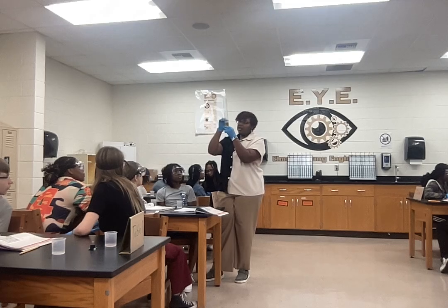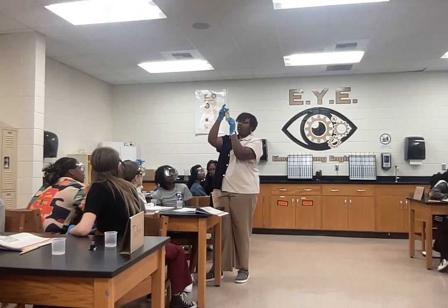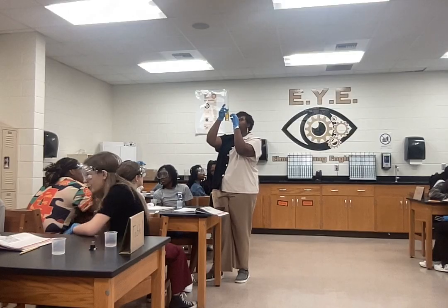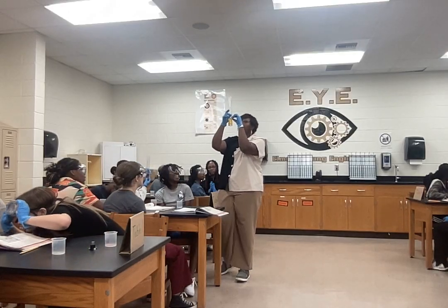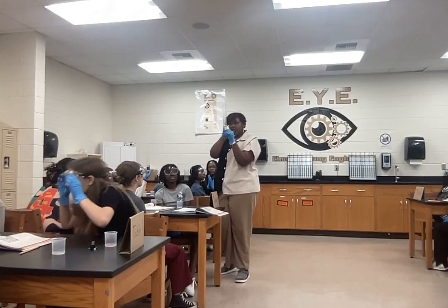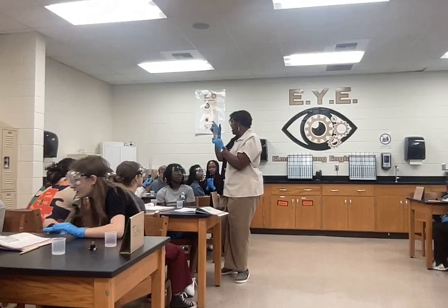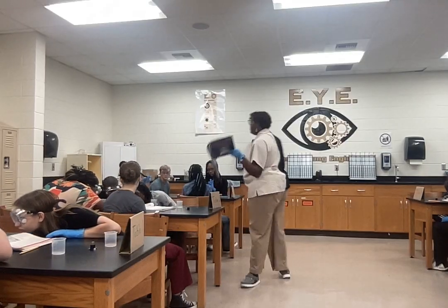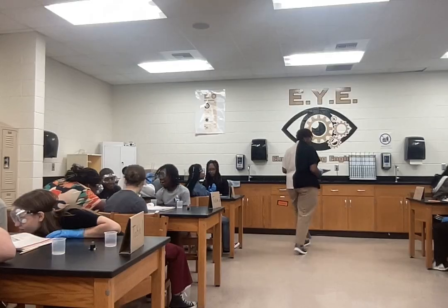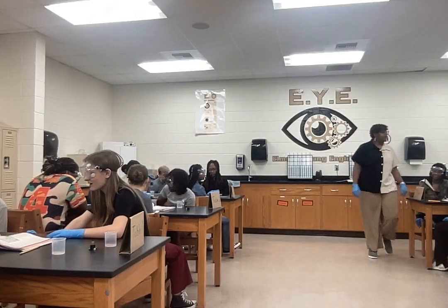So we've got a layer here, a layer. I see 4 layers. At the very top is a separate layer, a very thin layer. How many layers? 4.